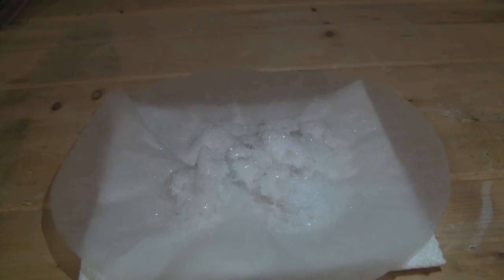This yield is not great, but some of this can be chalked up to the aspirin being a little old and me not adding more water during the recrystallization step.